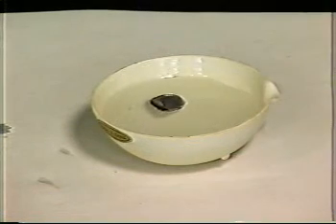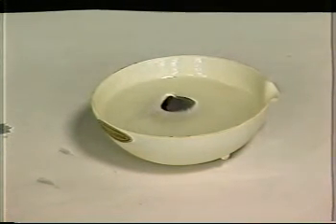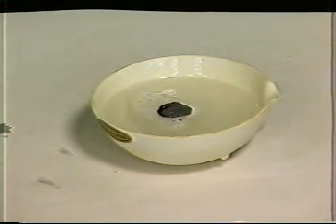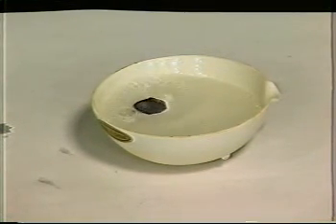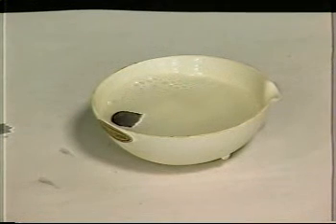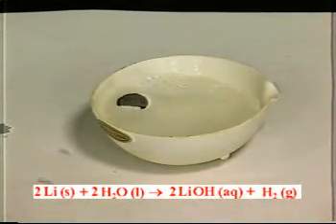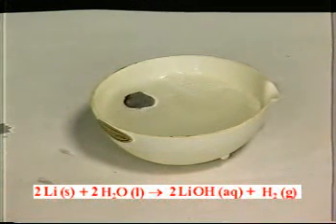I've got a ceramic dish with water in it, and I'm going to drop in a sample of lithium metal. Now, lithium's a group 1A metal. Look what happens when it hits the water. It starts reacting with the water, doesn't it? You can tell that by the bubbles that are being formed. Those bubbles are hydrogen gas. The chemical reaction is lithium plus water makes lithium hydroxide plus hydrogen.